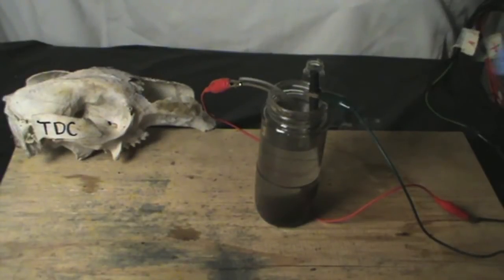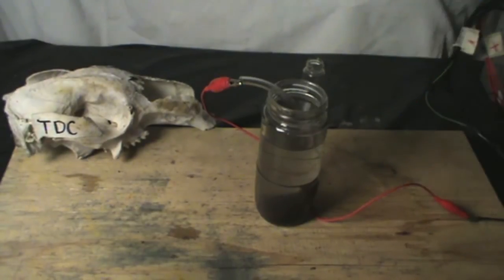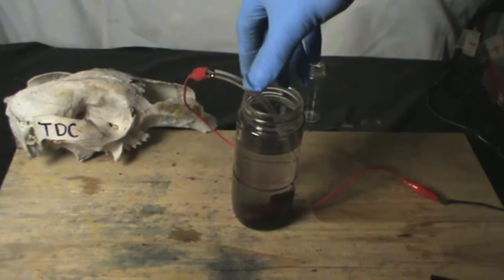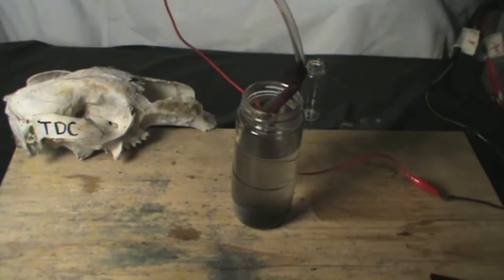Now turn the power off from the power supply unit and remove the electrodes from the solution. As we can see, a large mass of spongy copper metal has been deposited over the copper electrode, as well as some bits that have fallen to the bottom of the cell.